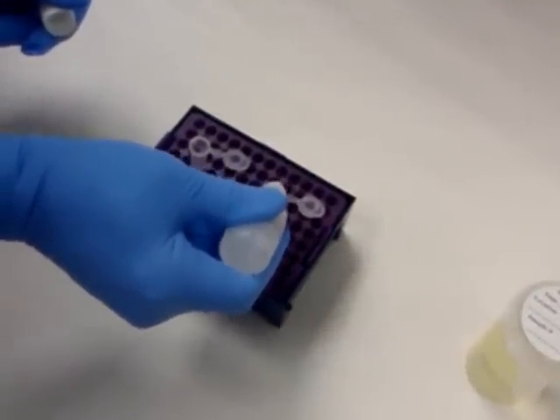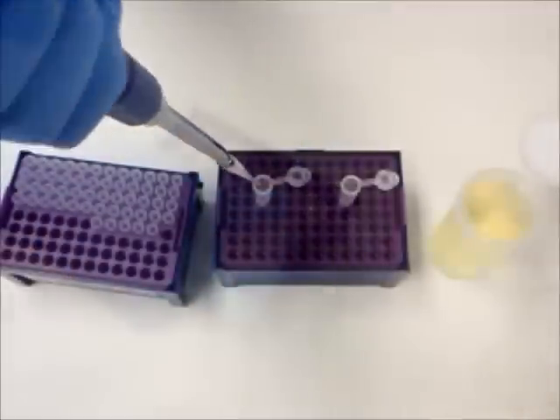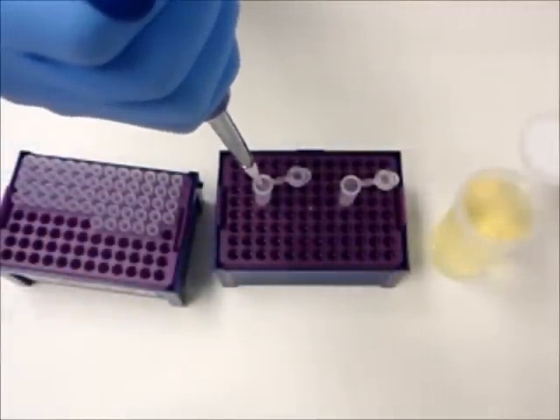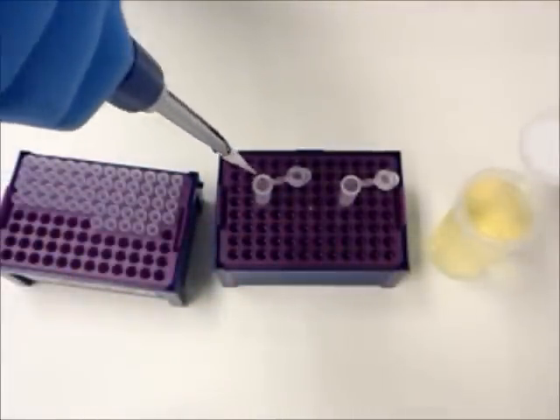With a disposable pipette or pipette tip, pipette 175 microliters of the liquid sample from the 100ml container taken from the incubator into the sample plastic mixing vial only. Wait 10 minutes.